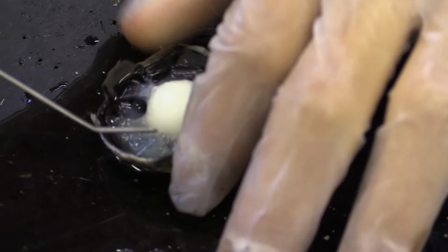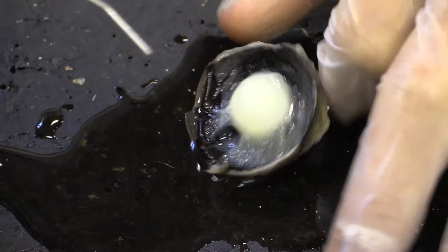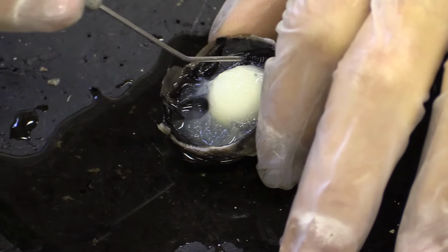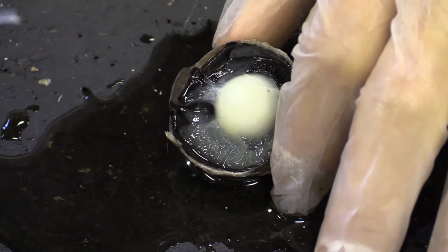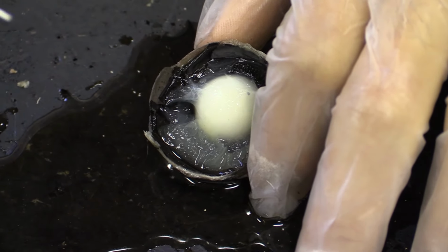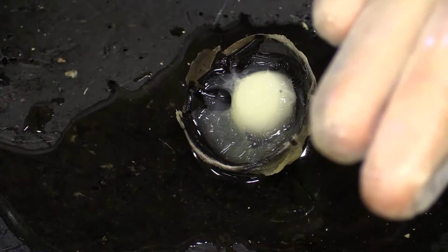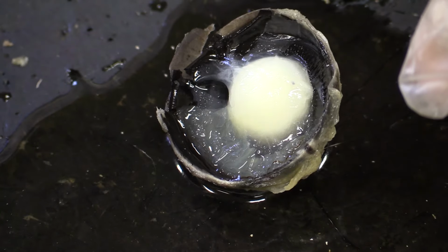And then, what's this? All this white, cling-film-like material is called the ciliary body. And it contains this striated structure here, with lines going along it. Right here, very clear, you can see these striations going straight across it. Those are actually suspensory ligaments, which directly attach to the lens. And against here you'd have your ciliary muscles, which would pull against those ligaments and change the shape of the lens, hence affecting where the focus point is against the retina.